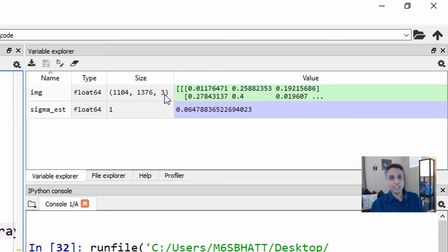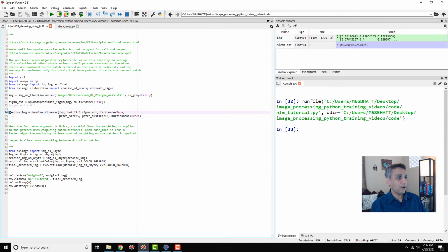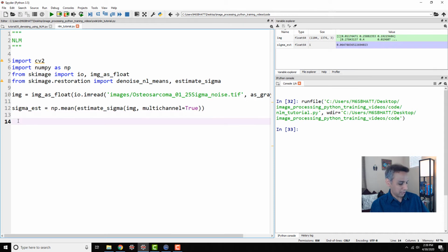And you can see the three channels here. My estimated sigma is coming up to about 0.064. If you want, you can just give your own sigma value, but let's go ahead and use that as a starting point. Now, how do you apply the non-local means filter? There are various parameters that you can supply.